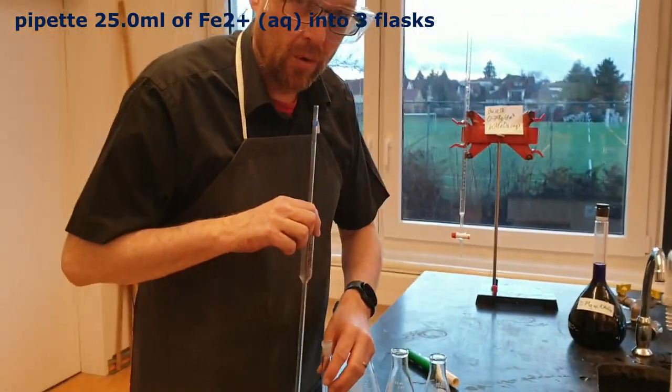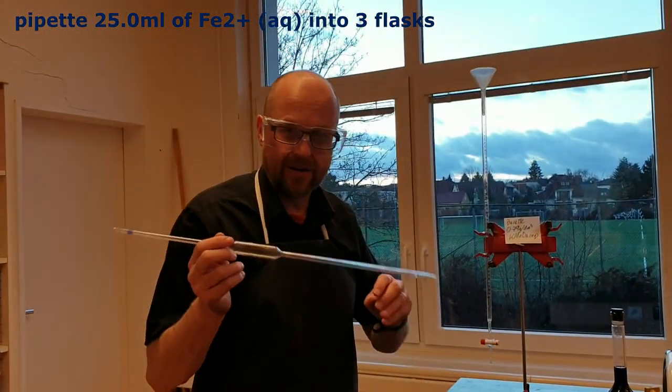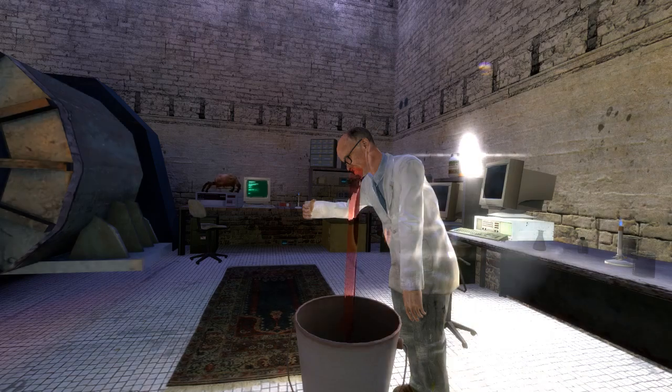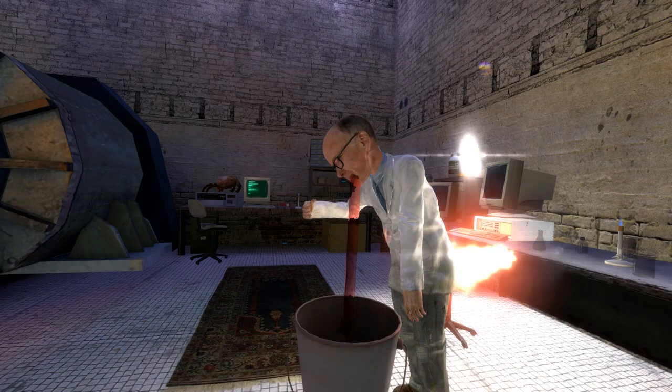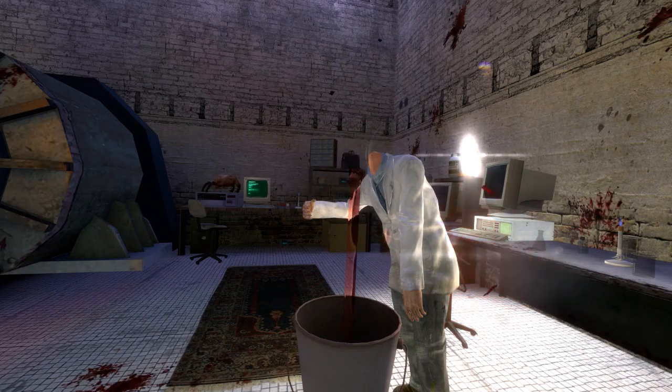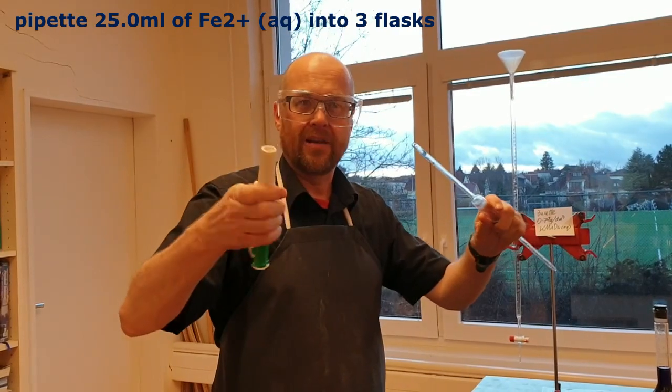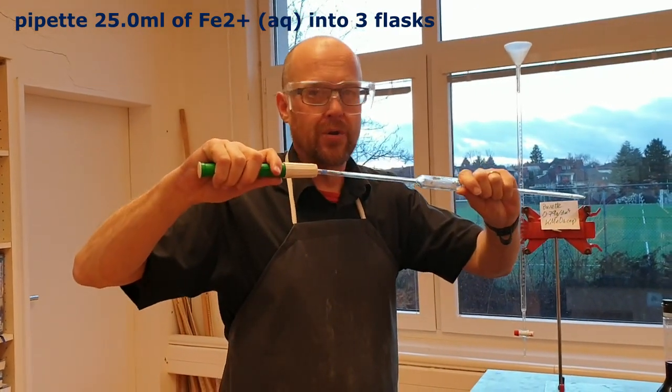No, no, no, no, no. We don't do pipetting by mouth anymore. We're going to use this pipette filler here. No, no, no, no, no.